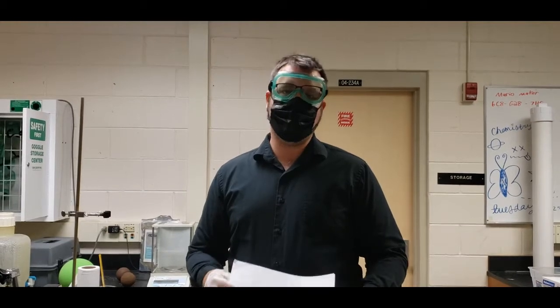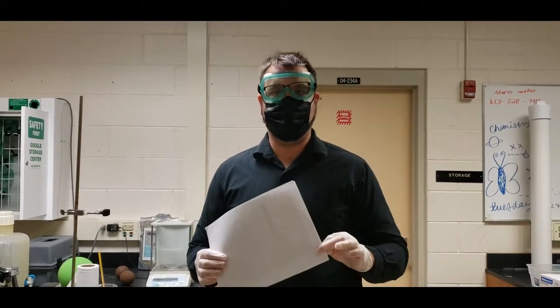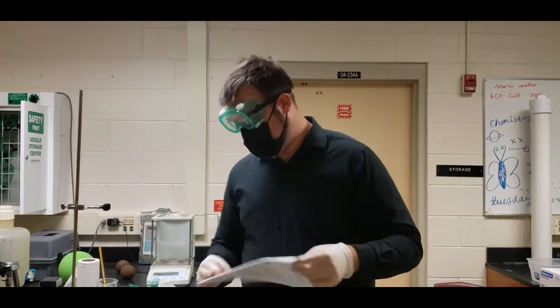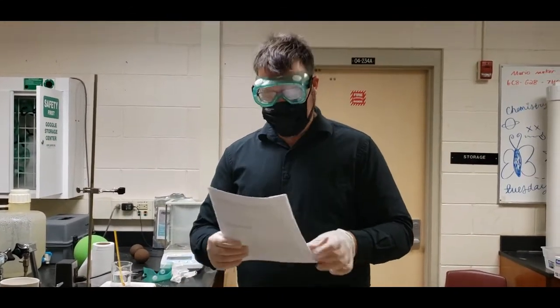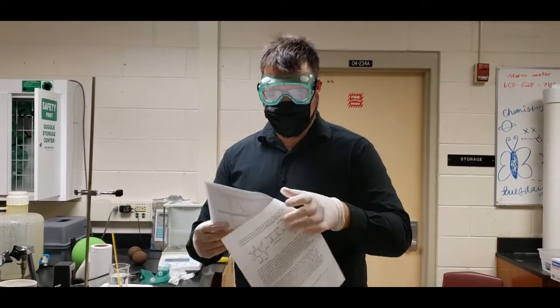Hello students, today we're going to go ahead and do the synthesis of aspirin lab. The very first thing that we need to do is make sure that we have all the materials as stated and that we know what each material is going to be used for.